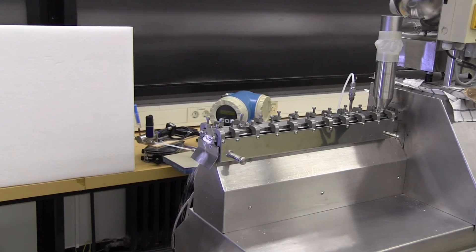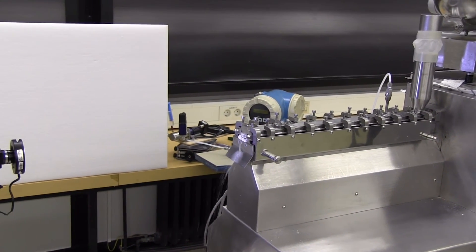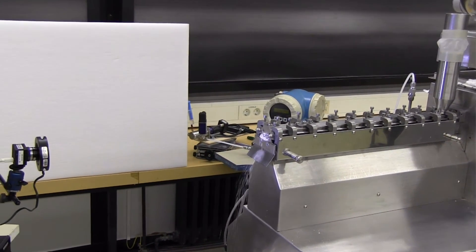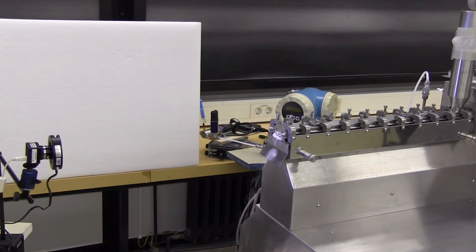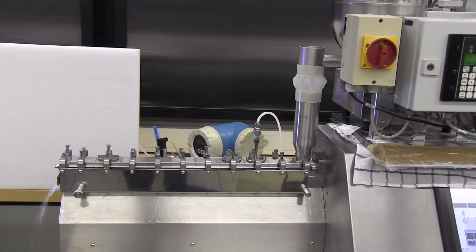In general the powder is fed onto two screws which can consist of conveying and mixing elements; the powder gets mixed on the turning screws. A binder is typically added via a liquid feeding port.